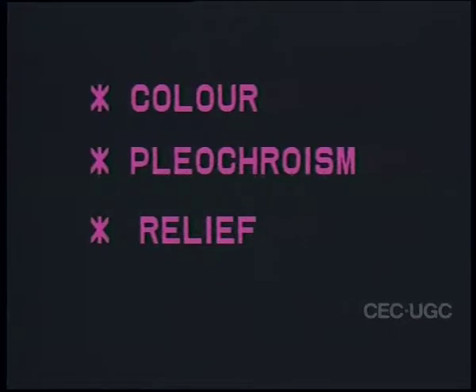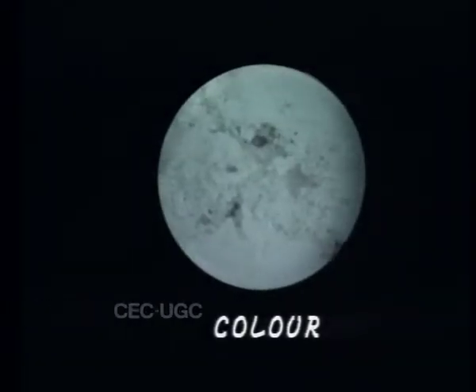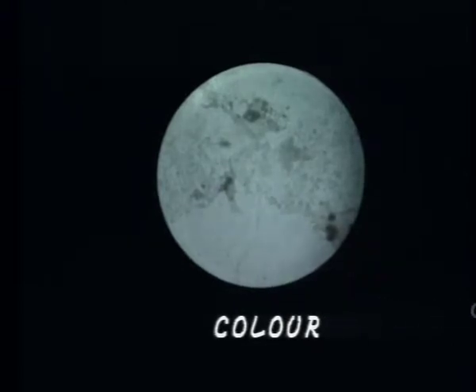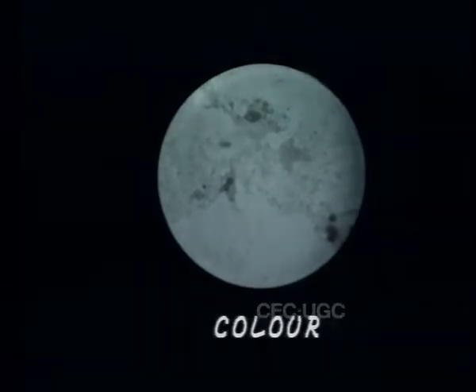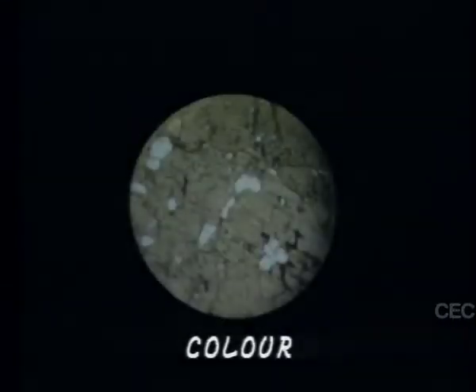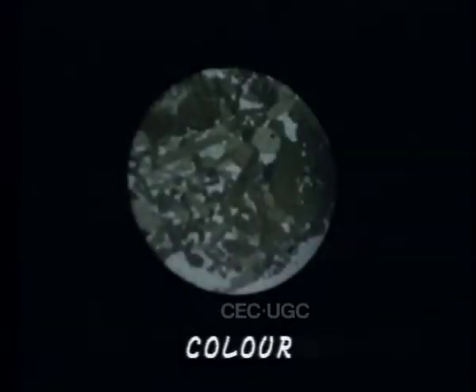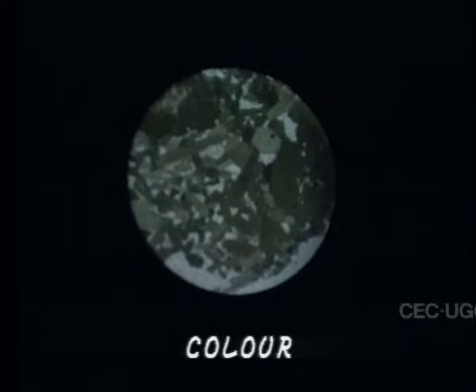The optical properties observed in plane light are color, pleochroism, and relief. A large number of minerals are colorless in thin section. These include common minerals like quartz and feldspars. There are others that show distinct colors. For example, aegirine shows yellow color, hornblende shows green color, and so on. Color is a diagnostic property of these minerals.